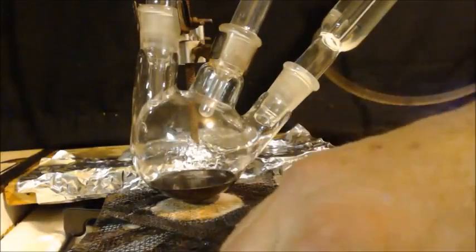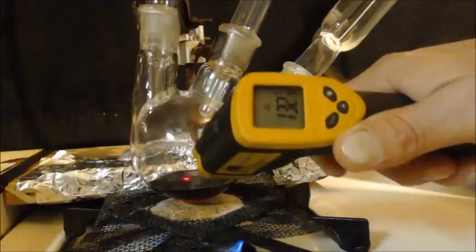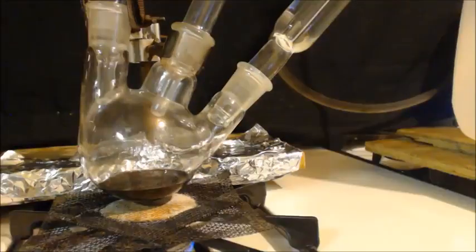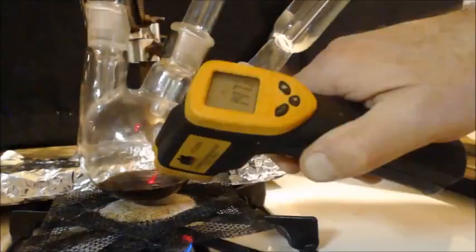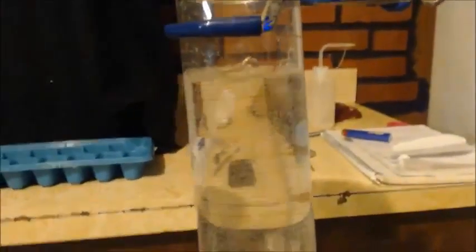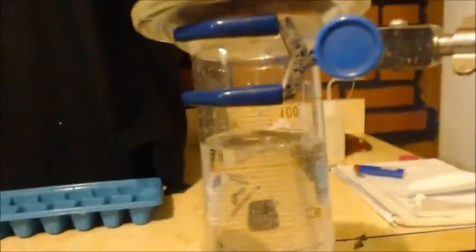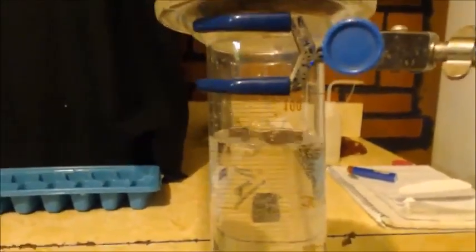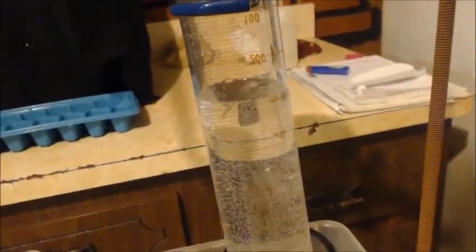Now it's only heating it for a minute, and it already turned black, so I turned it off. Put the camera on, it's already up to 170 right now. 130, 150. It smells like it's making it, but it ain't burning. Oh, there it is. I don't know if it's making it or not, only 150. It doesn't seem to catch on fire. I don't know if you caught it on film or not, but definitely caught on fire. At least it's coming out slow. I have no crazy stuff happening. Oh, I'm so happy about the speed that it's coming out, this is nice. I thought I was going to be running around like a chicken with his head cut off trying to collect all this gas.